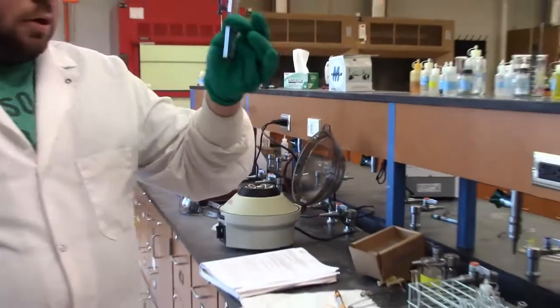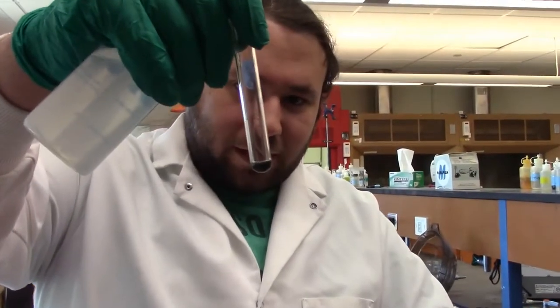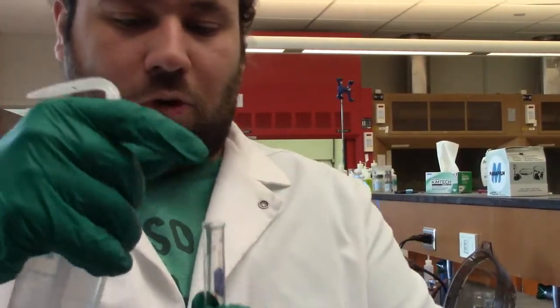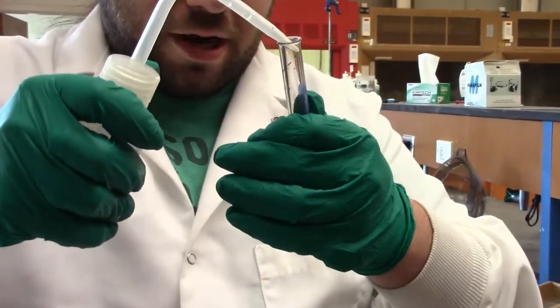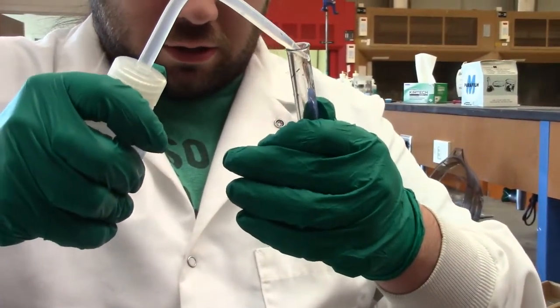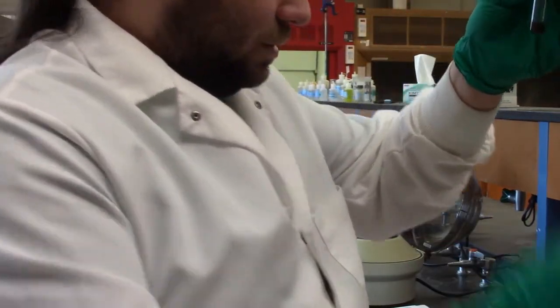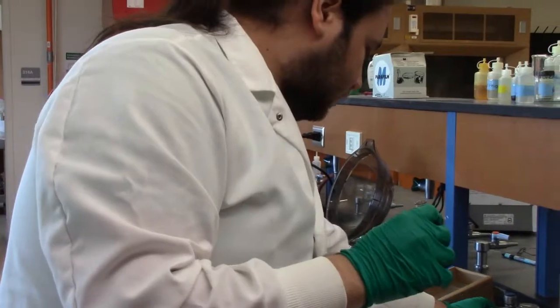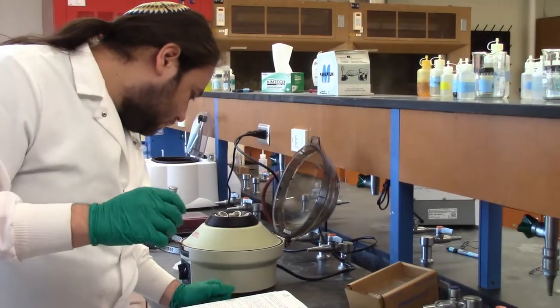Now, you're never going to get perfectly all the liquid out. As you can see there, there's still a little bit of liquid left in there. Kind of want to get it out. So I'm going to just put some DI water in there. It says about 10 drops. I'm not counting 10 drops from this thing. I'm just going to give a little squirt. Call that 10 drops. I'm going to decant that, and that's just going to go into our waste. Do we have to centrifuge it before we decant it again? Does it say centrifuge? I'm not sure. I don't remember.